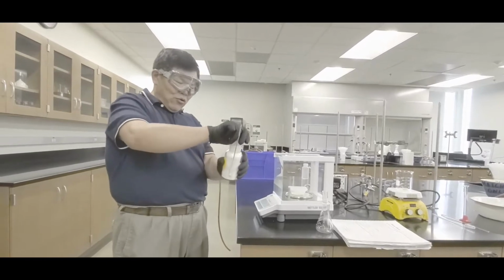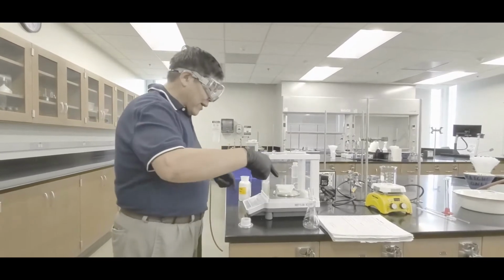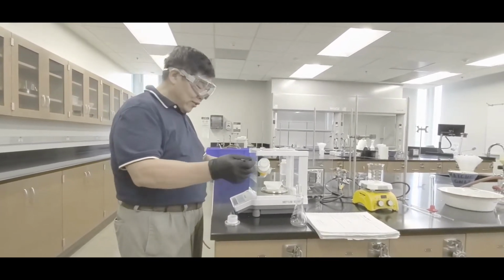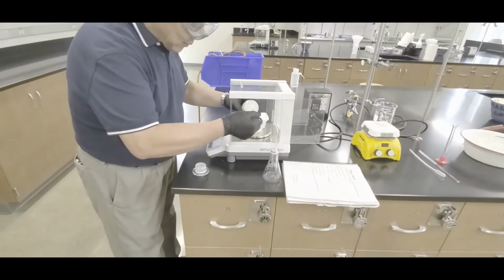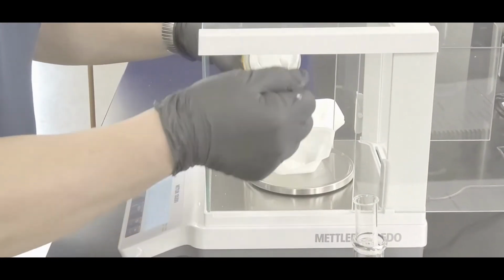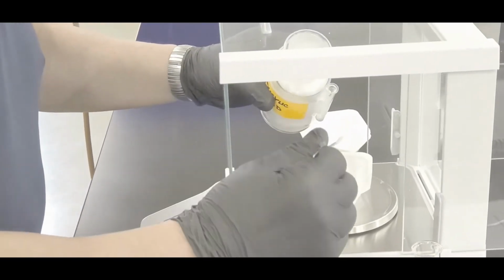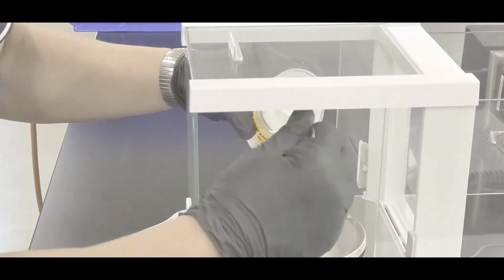So what you do is, open that up. Now here's the thing, when you're weighing things like that, don't go around like that. So what you do is you open up both windows, okay? And then stick the bottle through with one hand, and use a spatula on the other hand. And you're gonna scoop in till it hits about 0.4 something. So, one. Wait, okay, that's point. Okay, so I got about 0.5 something.